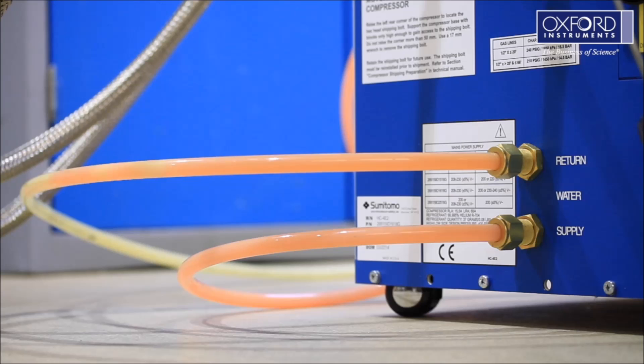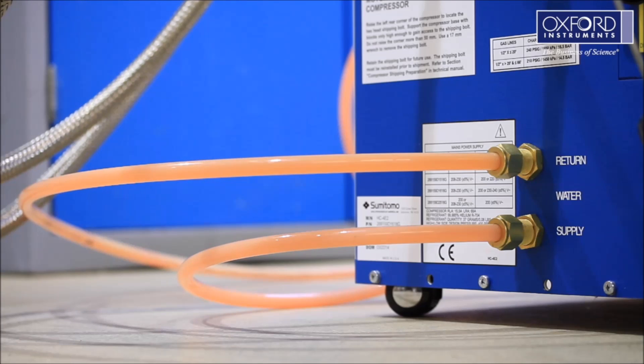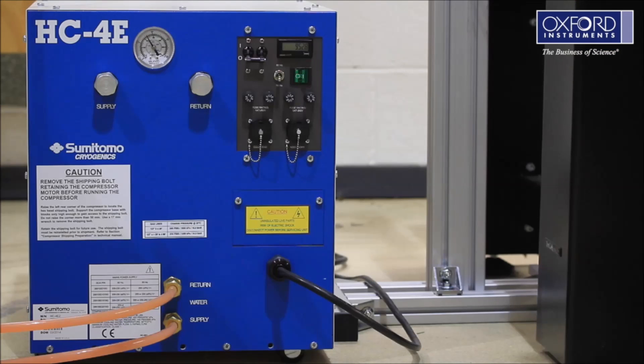Start the water flow and make sure you have no leaks. You must provide suitable electrical power for your compressor. Please make sure you understand all the health and safety requirements before you do this.